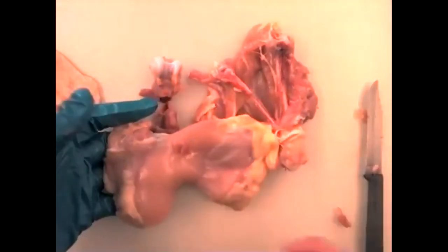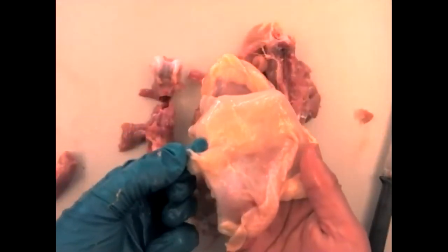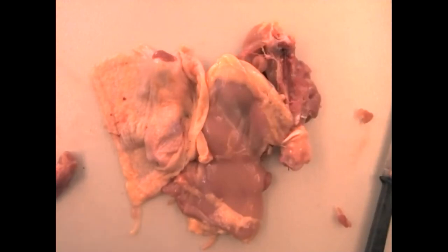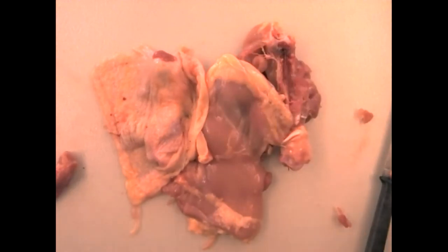To summarize: tibia is the big, strong shin bone; fibula is the skinny shin bone; femur is the thigh bone. The gastrocnemius is the calf muscle we care about. On the thigh, the front muscles are the quadriceps femoris and the posterior muscles are the hamstrings. All of that is covered by the skin, which also contains adipose tissue and fascia. With that, I'm going to stop recording.